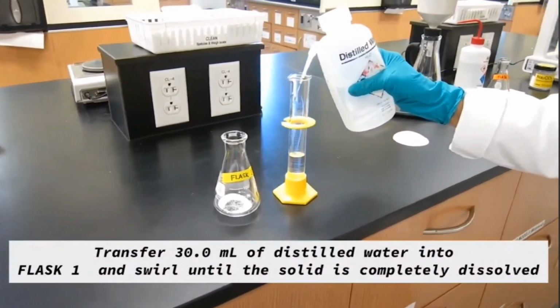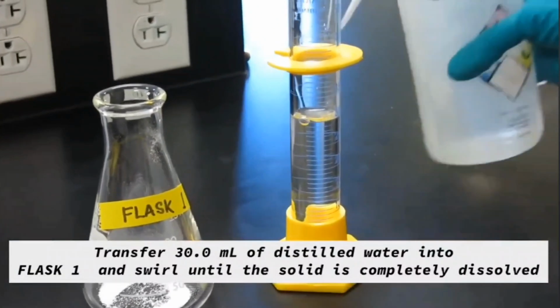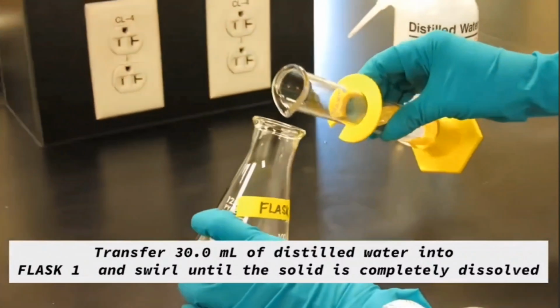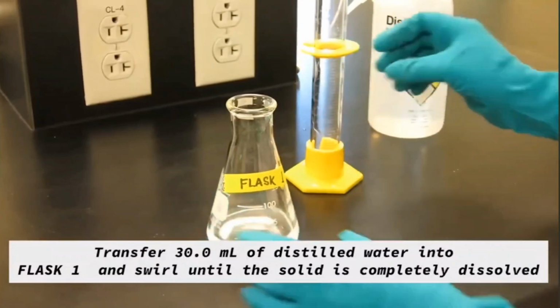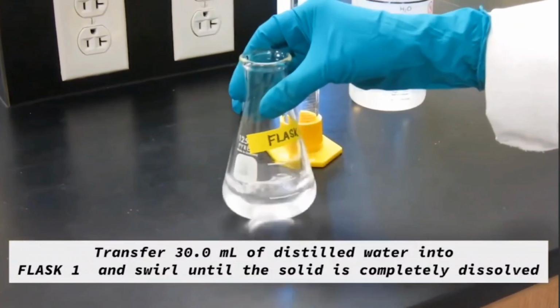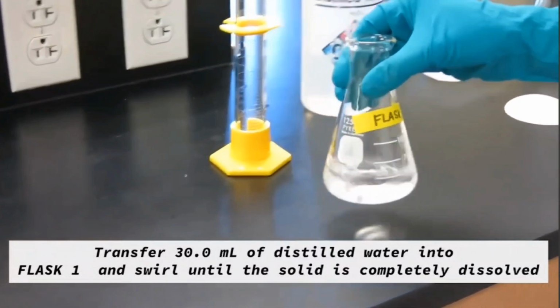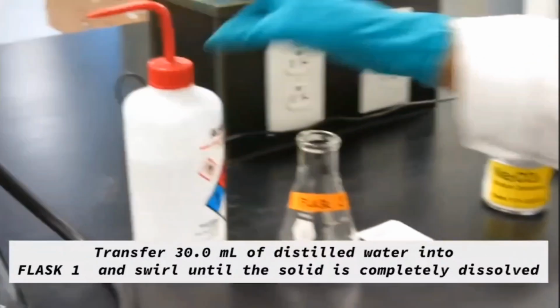And this solid needs to be dissolved in water to make an aqueous solution. So you're going to take 30 milliliters of distilled water into the graduated cylinder, and then you're going to pour it into flask 1, which has calcium chloride in it. And you're going to swirl the flask until the solid is completely dissolved. Now your flask 1 with calcium chloride is ready.